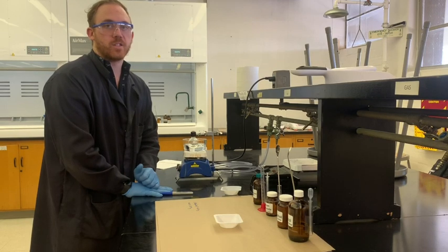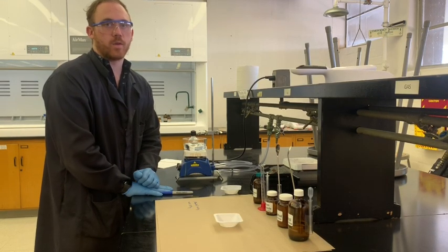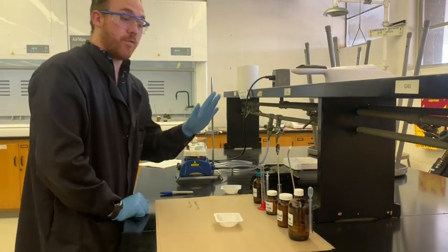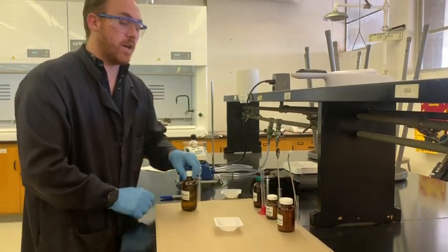If you have a really full flask and there's a boil over, things can get really bad really quickly. That's a very important safety tip there, but I've learned from experiences. It can get really ugly really fast.